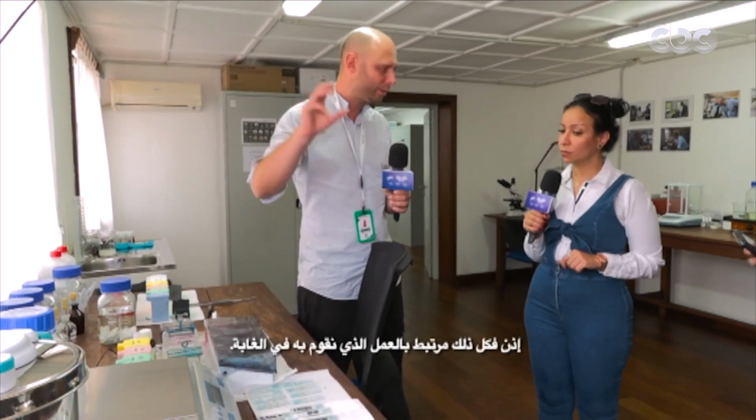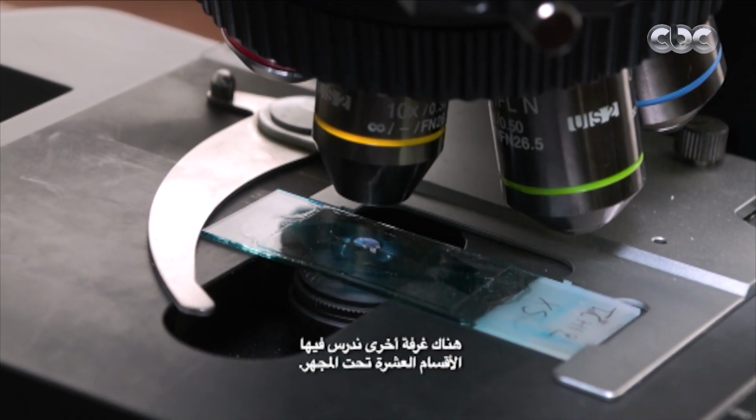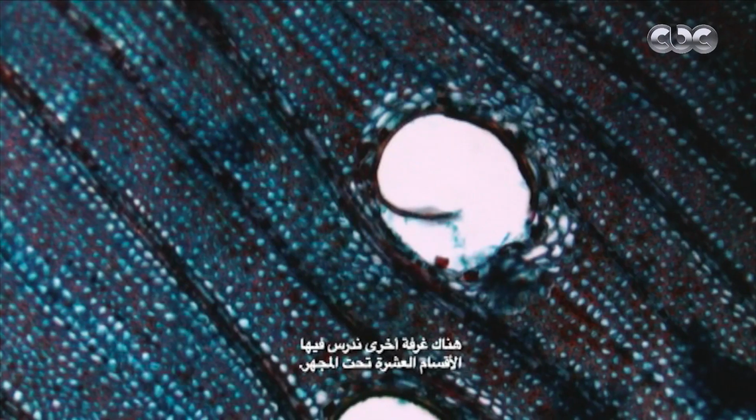So this is connected to the work that we do in the forest. There is another room over there. That's where we study the thin sections under the microscope.